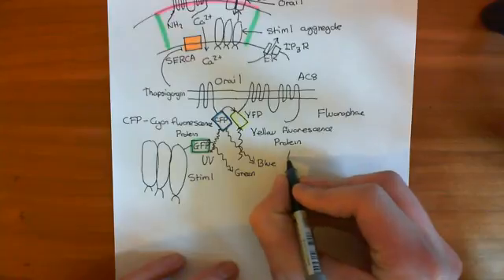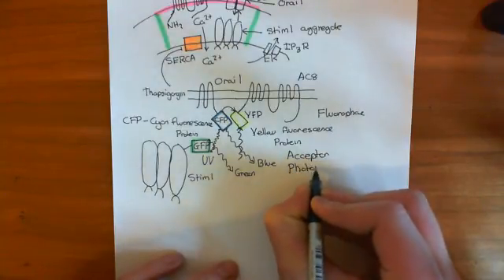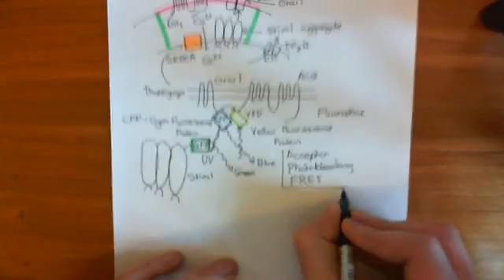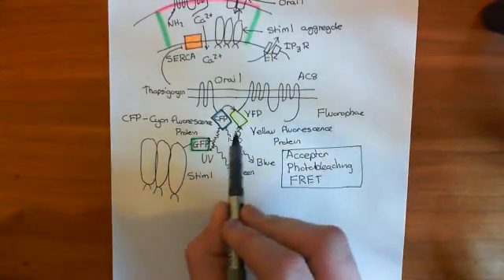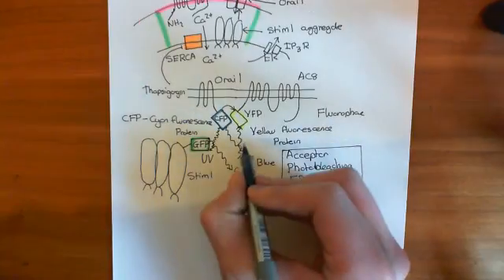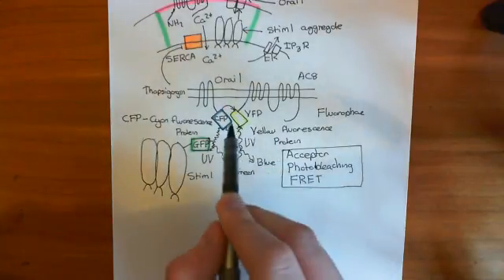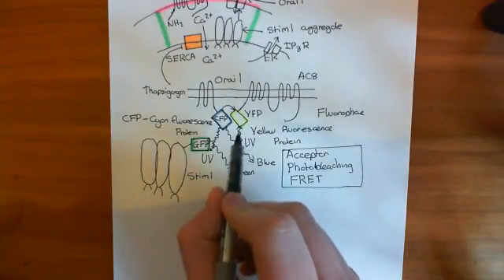To confirm this result even more, you can use acceptor photo-bleaching FRET — acceptor photo-bleaching fluorescence resonance energy transfer in full. With this second type of FRET, you first do the normal type of FRET, and then you shine in a really high intensity UV light at the frequency for yellow fluorescence protein. Using really high intensity — this is the photo-bleaching part — it destroys yellow fluorescence protein's ability to fluoresce, so you have now knocked yellow fluorescence protein out.